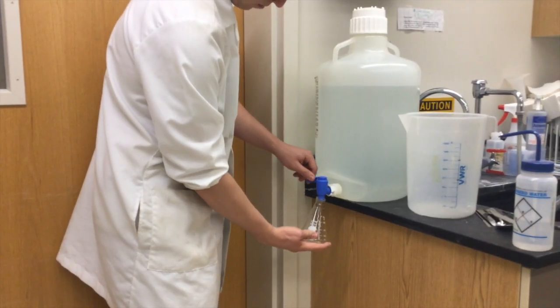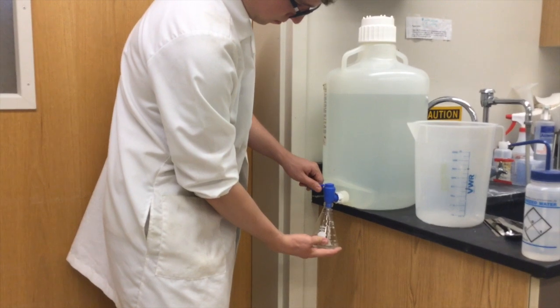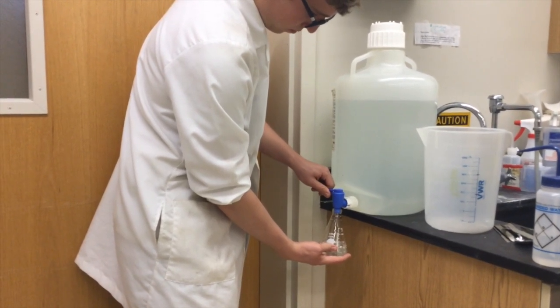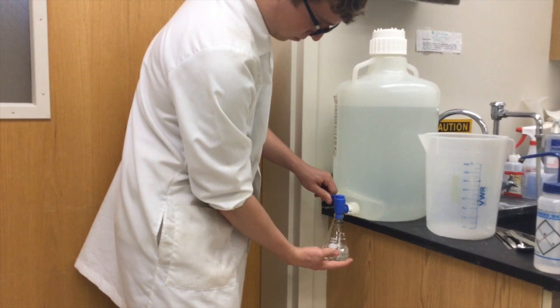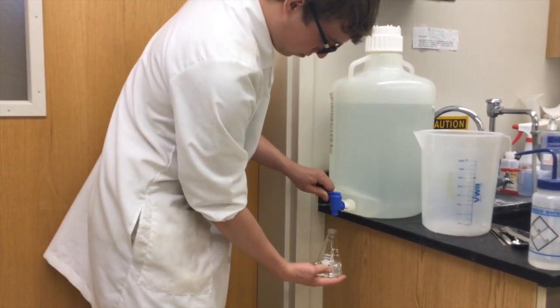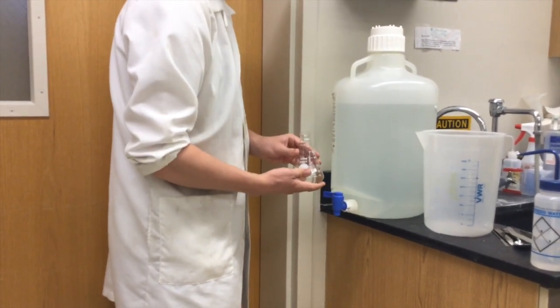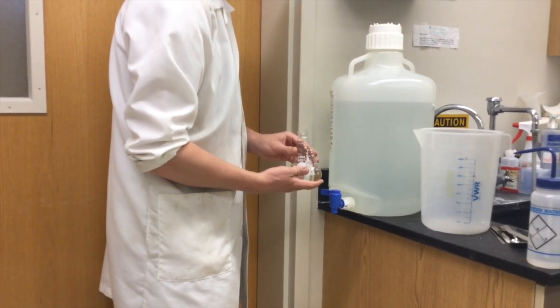Now take your flask and add about 150 milliliters of nano-pure water to it. Keep in mind that nano-pure water is not sterile. It has just been filtered further than distilled water. Normally, for making molar solutions, we use nano-pure water.